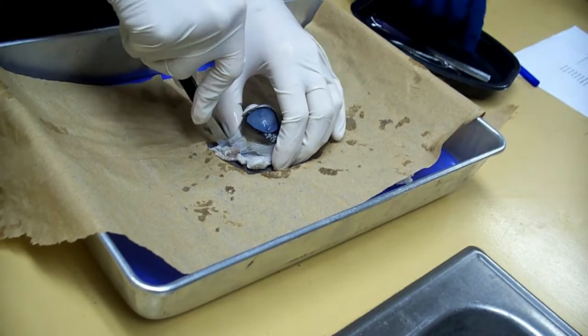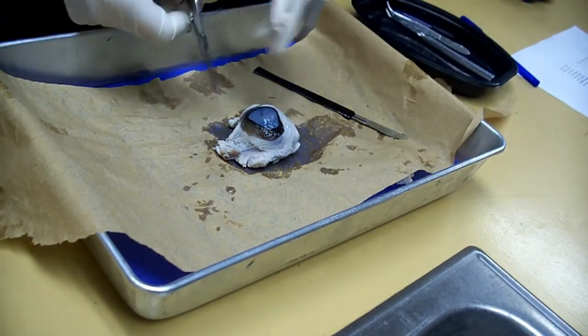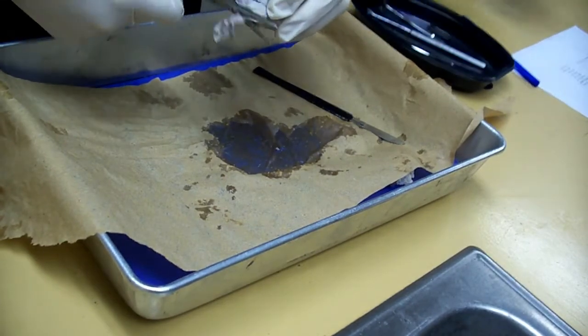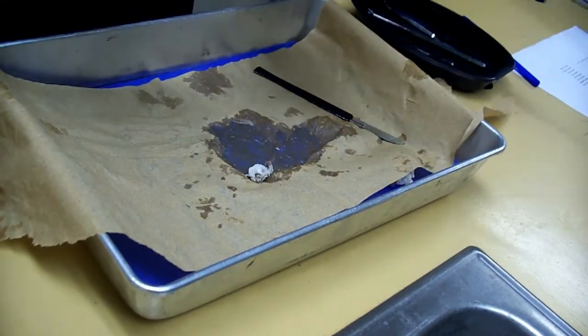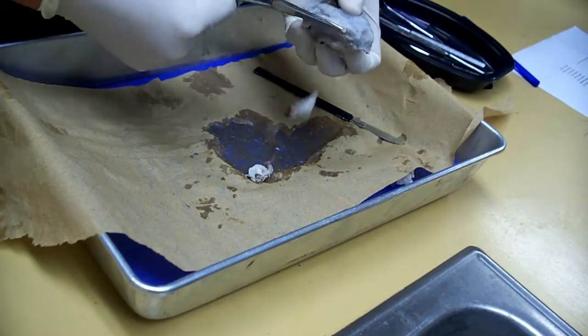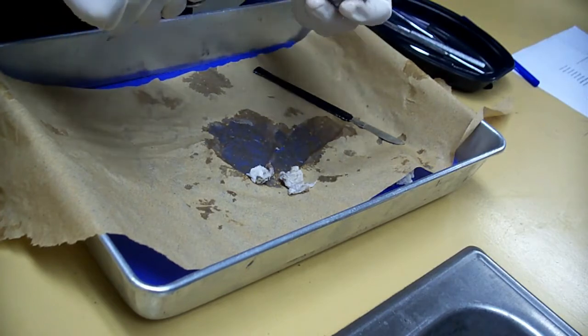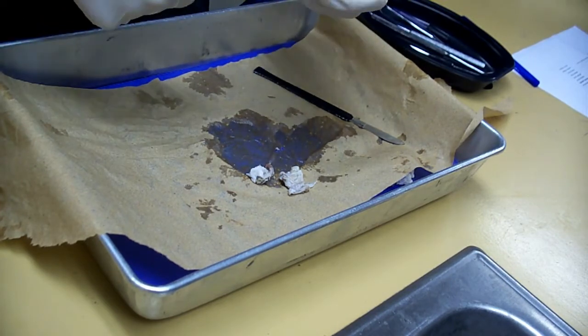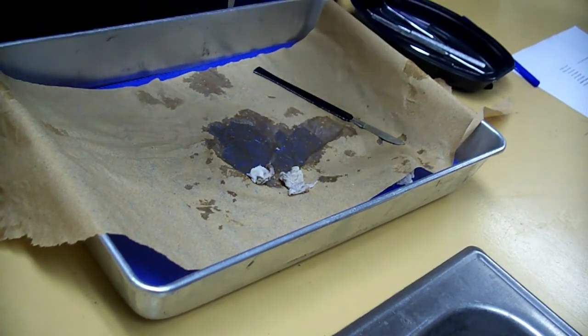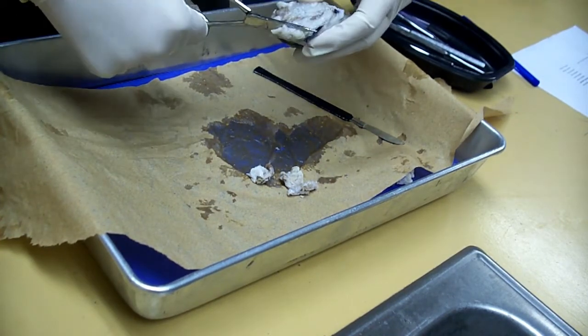Is that thing even sharp? We'll see. It says identifying iris, the cornea, the conjunctiva before you even cut into it. Now when you get the C or D, the one where you cut it out, what you can do is stick the scalpel in there first. Oh, that didn't sound good. Be very careful, guys. I don't want anybody to get hurt.